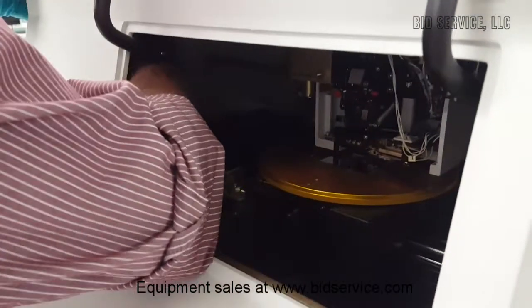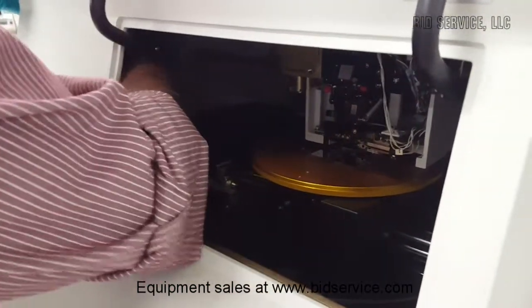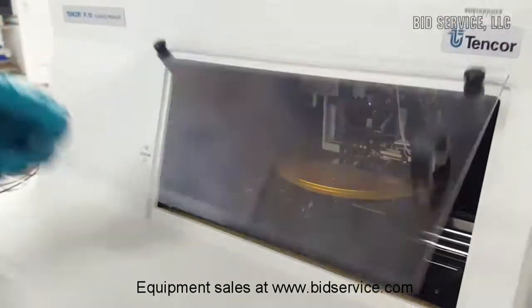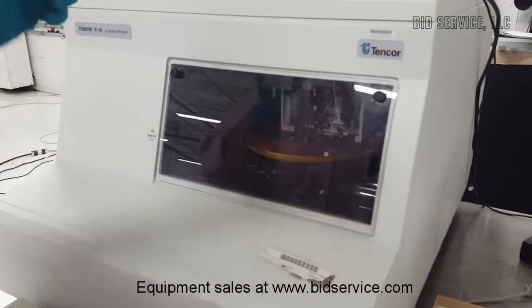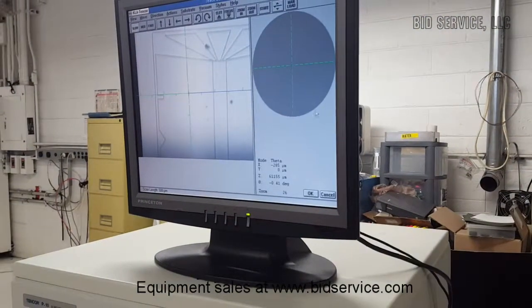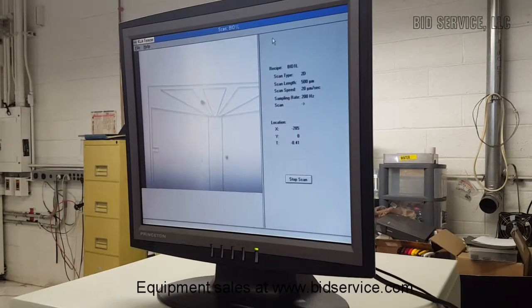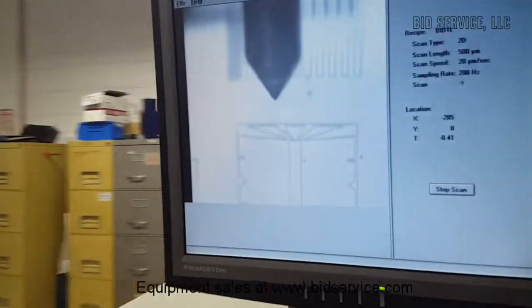So I'm going to scan a couple more standards and demonstrate the system is working in all the various ranges. So let's go back. So this is a 9000 angstrom standard, and I'm going to scan it one more time.